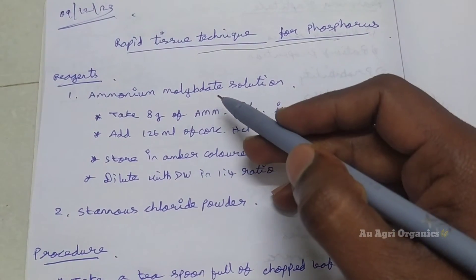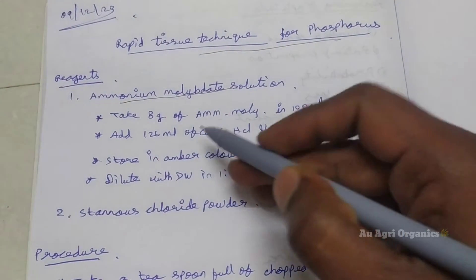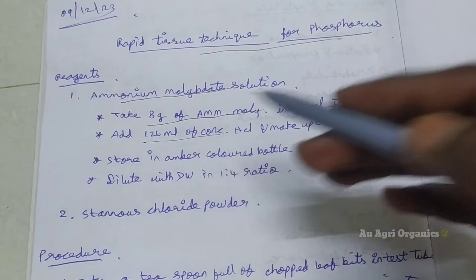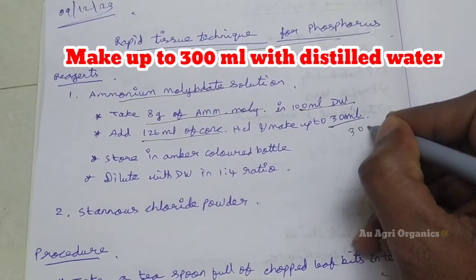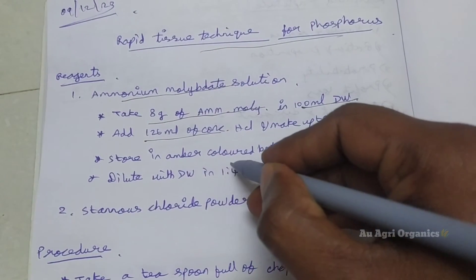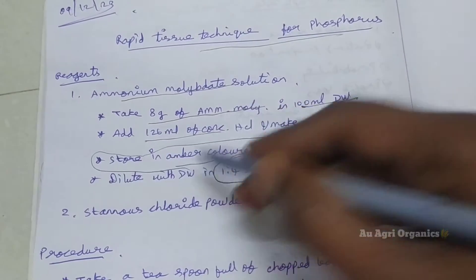Here we will see what reagents are required for this Rapid Tissue analysis of Phosphorus. The first solution needed is ammonium molybdate solution. For this, we have to take 8g of ammonium molybdate in 100ml distilled water, then add 126ml of concentrated hydrochloric acid and make up the volume to 300ml. If we are using it immediately, we have to dilute it with distilled water in the ratio of 1:4, or else we can store it in an amber colored bottle for later use.